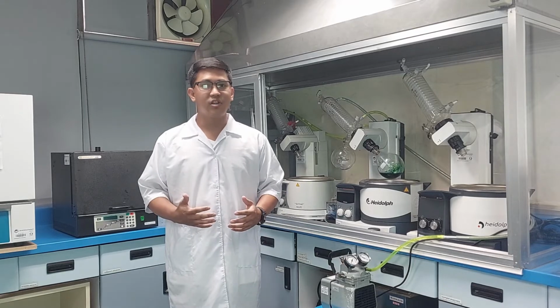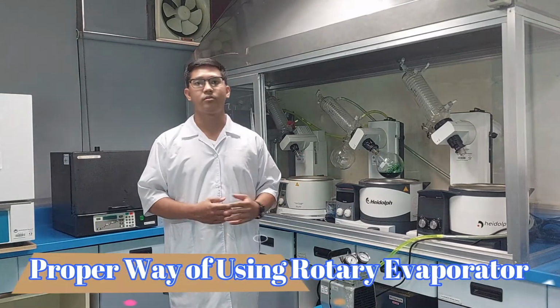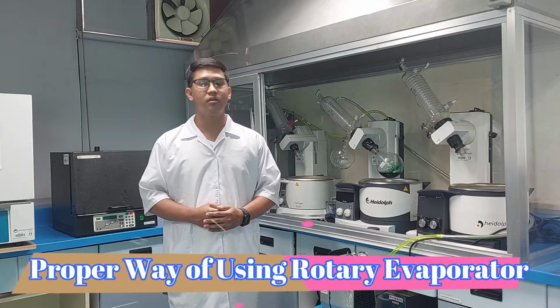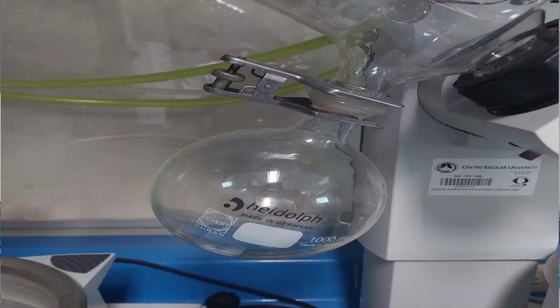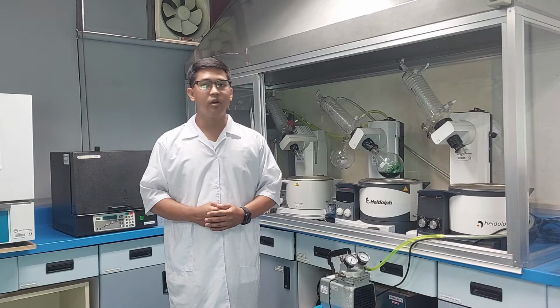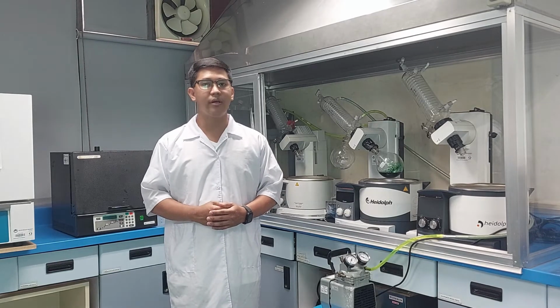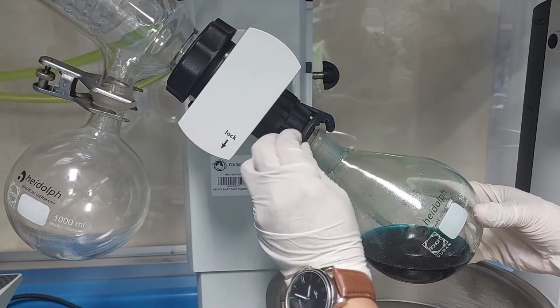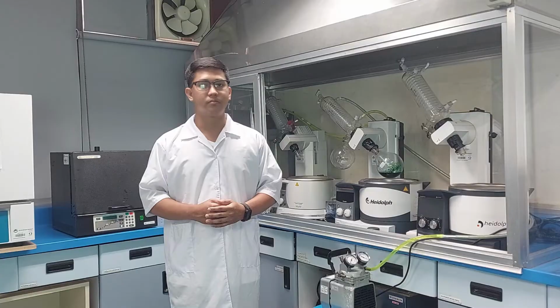The proper way on how to use a rotary evaporator. The receiving or solvent collection flask of the unit should always be emptied prior to use to prevent accidental mixing of incompatible chemicals. Fill the round bottom flask not more than half full with the solution to be evaporated. Then connect the flask to the equipment using a keck clip to ensure the flask doesn't slip off.